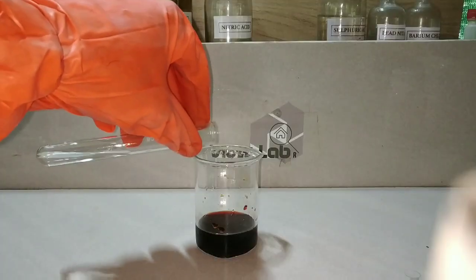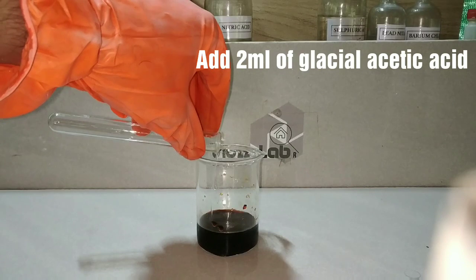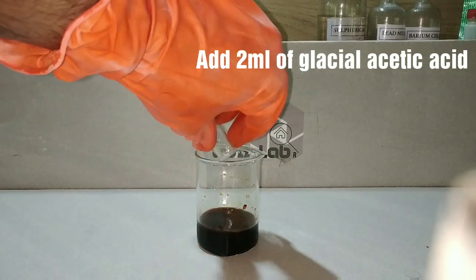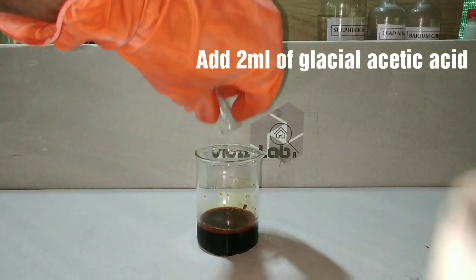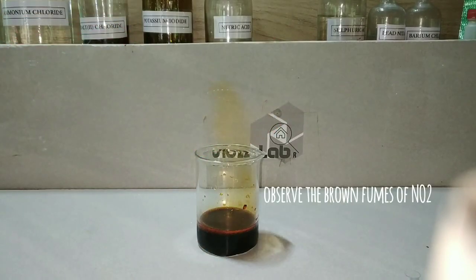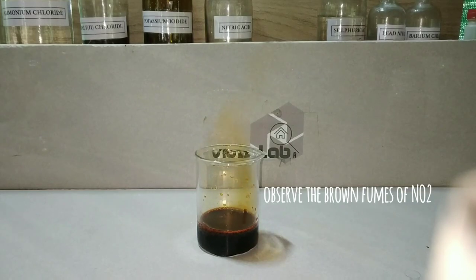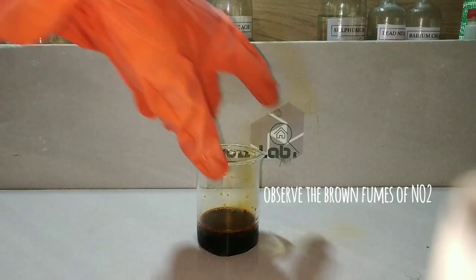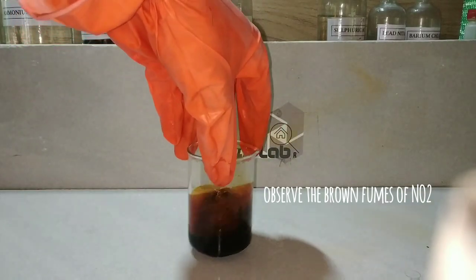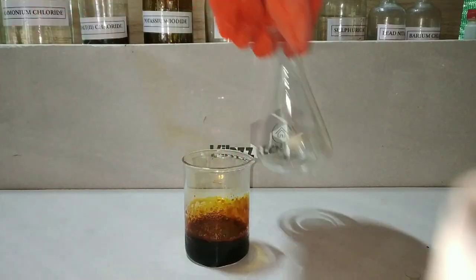Into this solution we add 2 milliliters of glacial acetic acid. On adding the glacial acetic acid, we can see the formation of brown colored fumes of nitrogen dioxide.